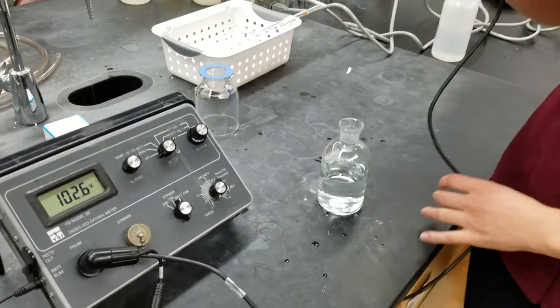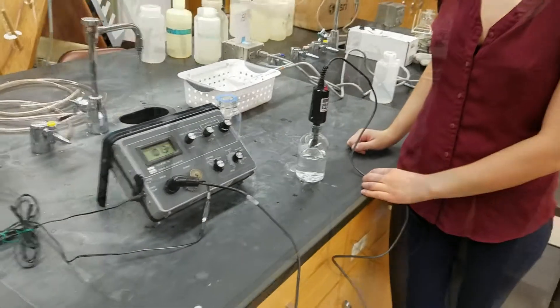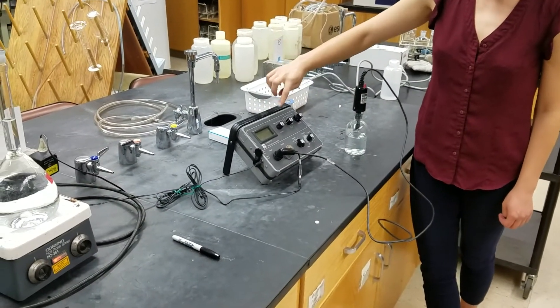And then once you've tapped any water out of there, then you're ready to calibrate. And here we're going to calibrate it.